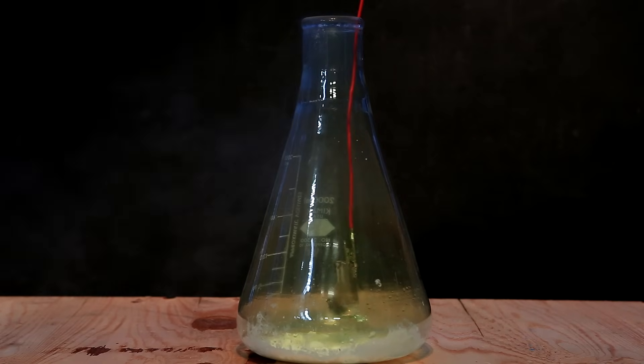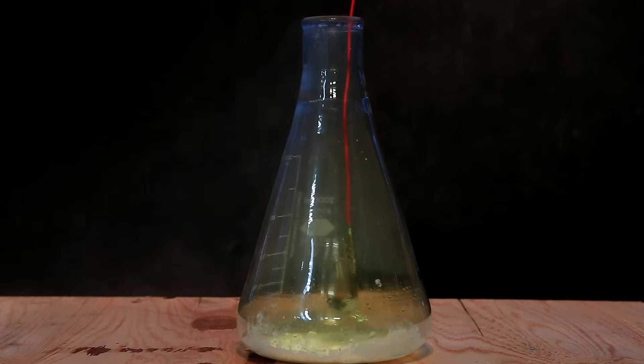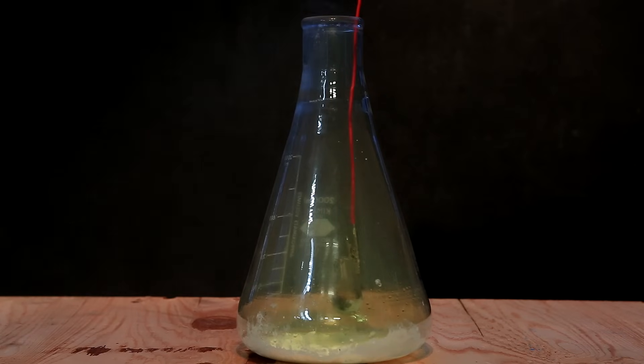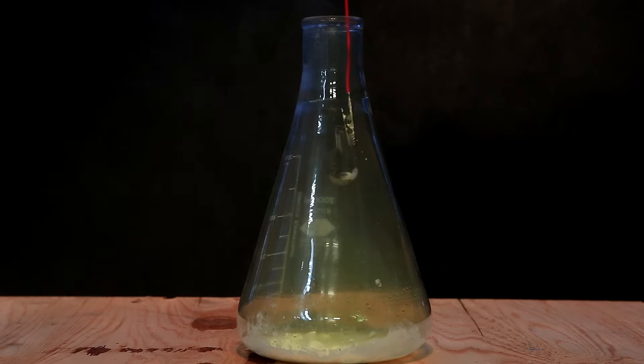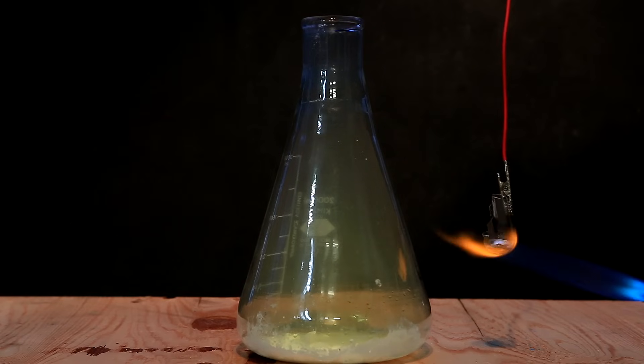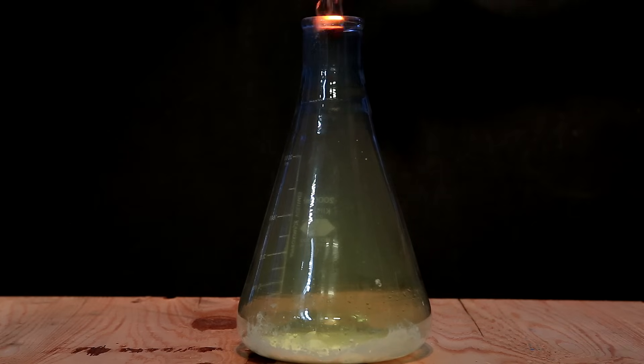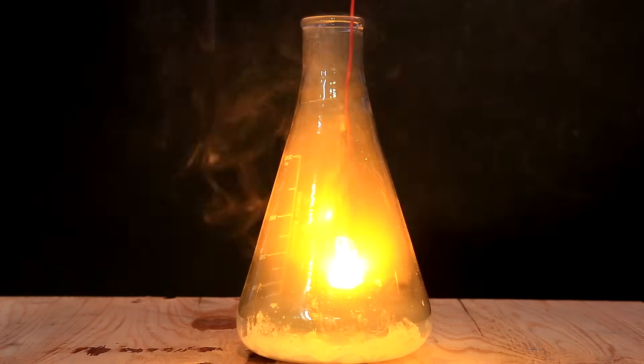Despite it going out, all of the sodium that was exposed to the chlorine became nice white sodium chloride, but unfortunately, this is not the spectacular reaction that I was expecting. I took the sodium back out, and I heated it a lot until it was molten red. This time, when I placed it back into the chlorine, it was a much more spectacular reaction.